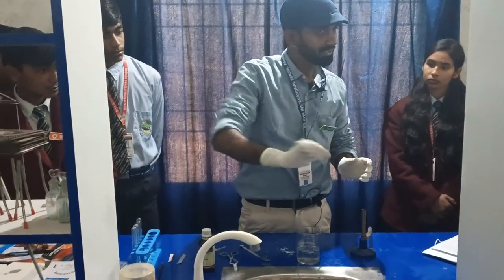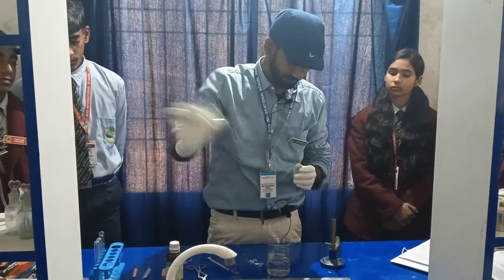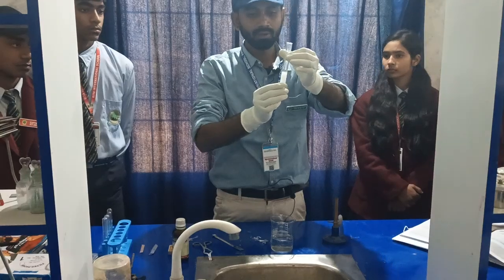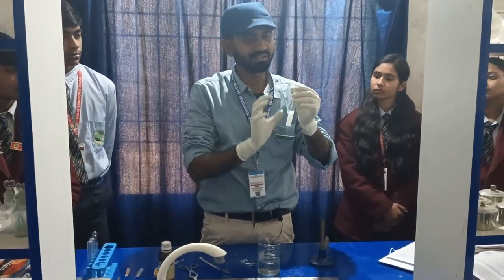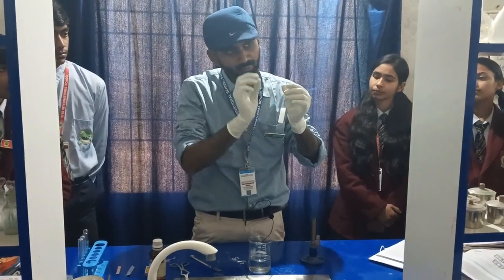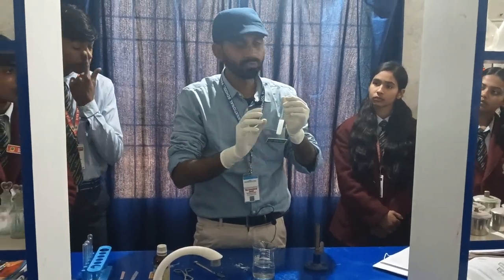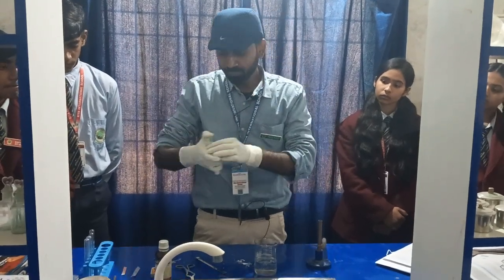We are going to vigorously shake the test tube so that it mixes well. The white color you see is the undissolved magnesium oxide ash, but some of it has combined with water to form magnesium hydroxide.